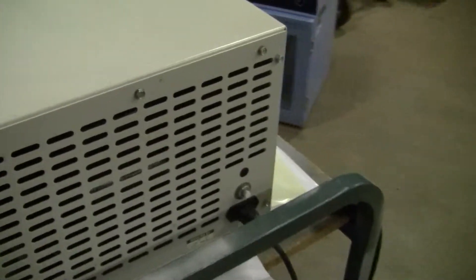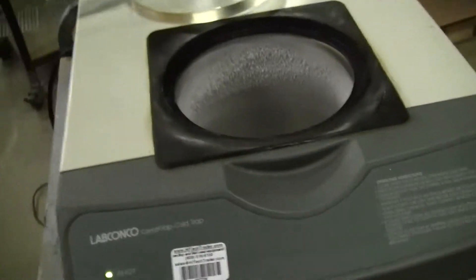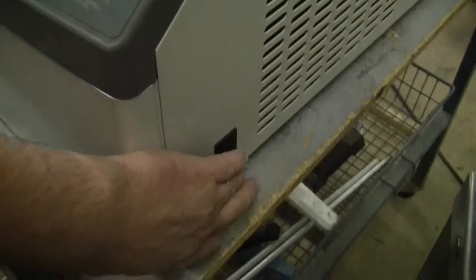Running off 115 volts. Fuse in the back. Unit's ready to go. Power is on the side.